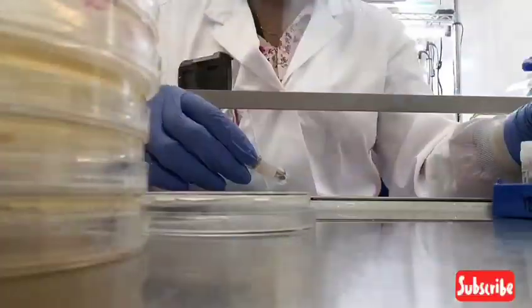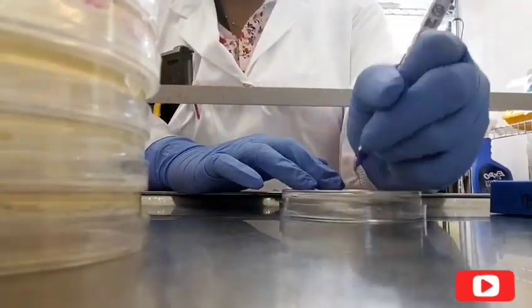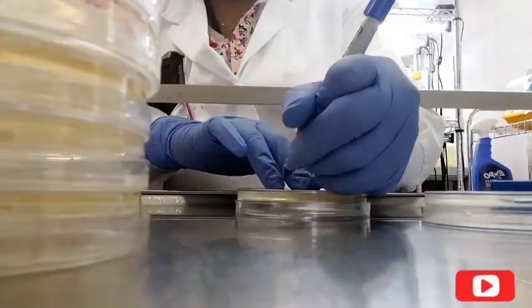And that's the vial with the agar plugs. And I'll take a piece out of the vial and place it on the center of the agar. And then that is the process of inoculation. So watch me do that.